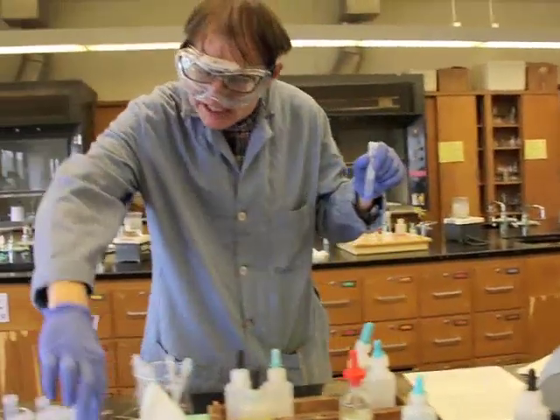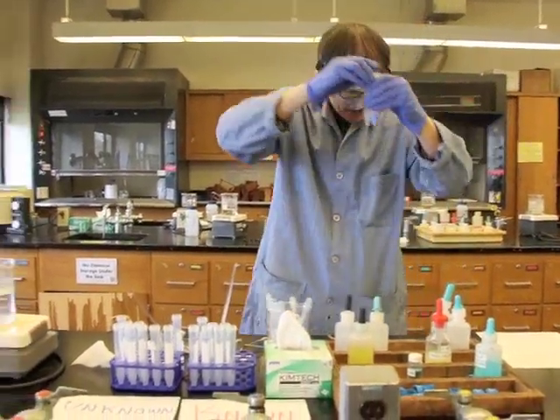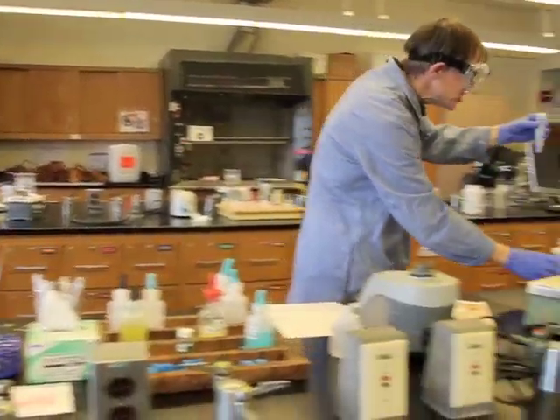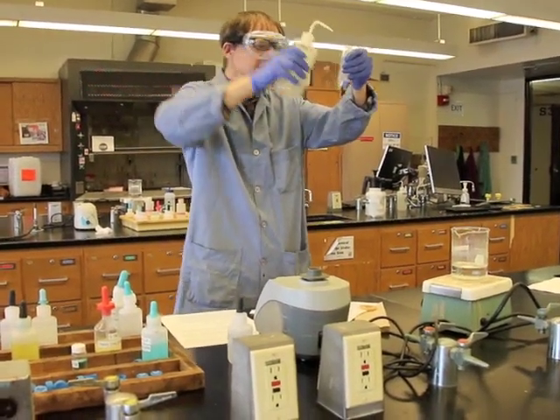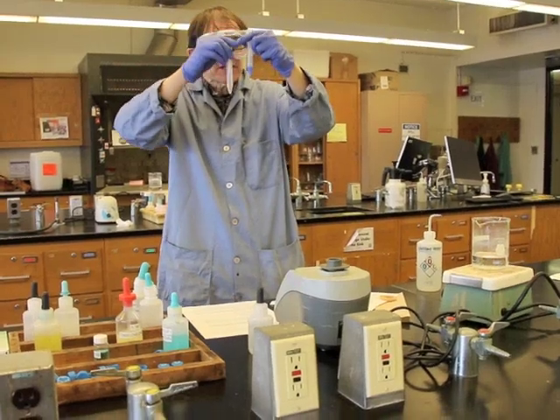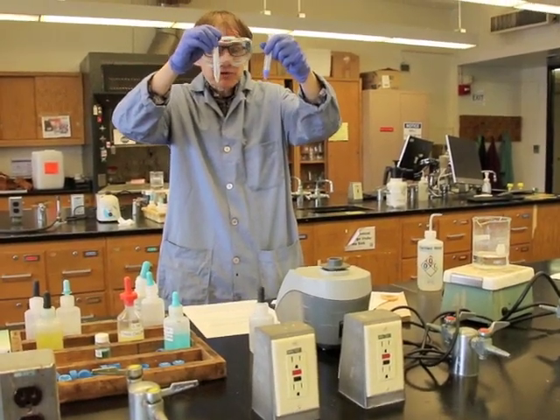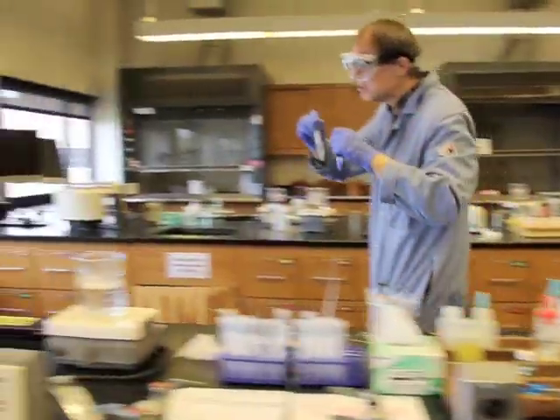So to use the centrifuge, we need to have a counterweight. And that counterweight should weigh about the same. So I'm going to add some distilled water into this counterweight. If this solution here were clear, I would want to definitely label these to know which one is which, but you can definitely see a difference in the solution, so there's no need to do that.